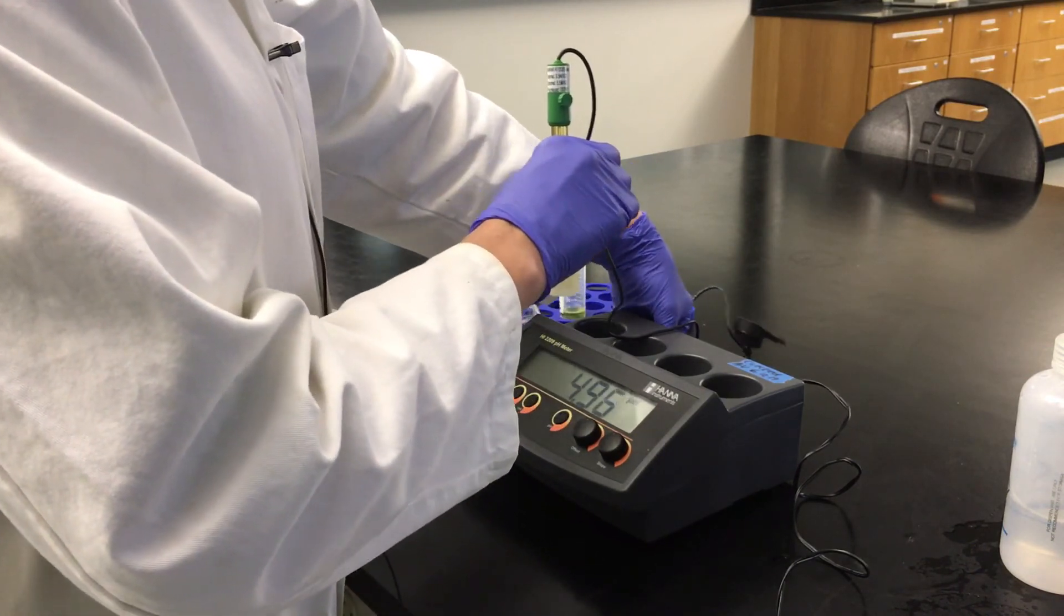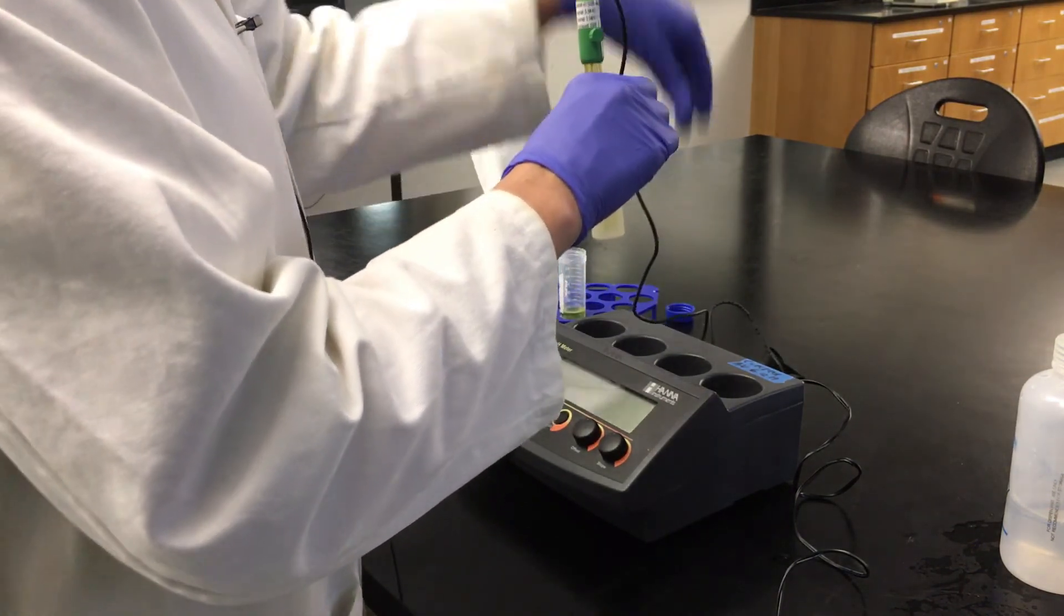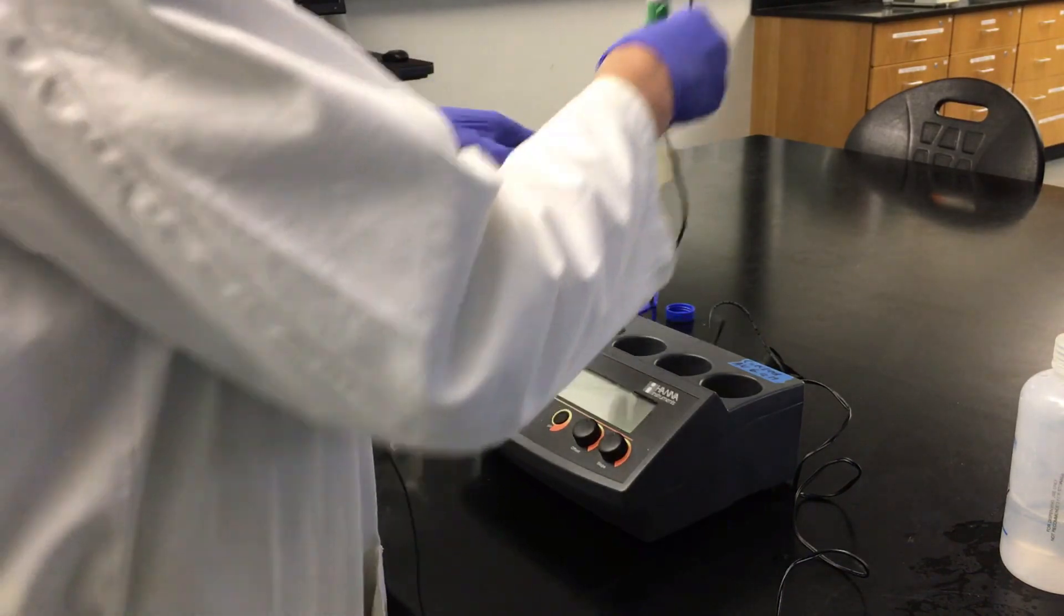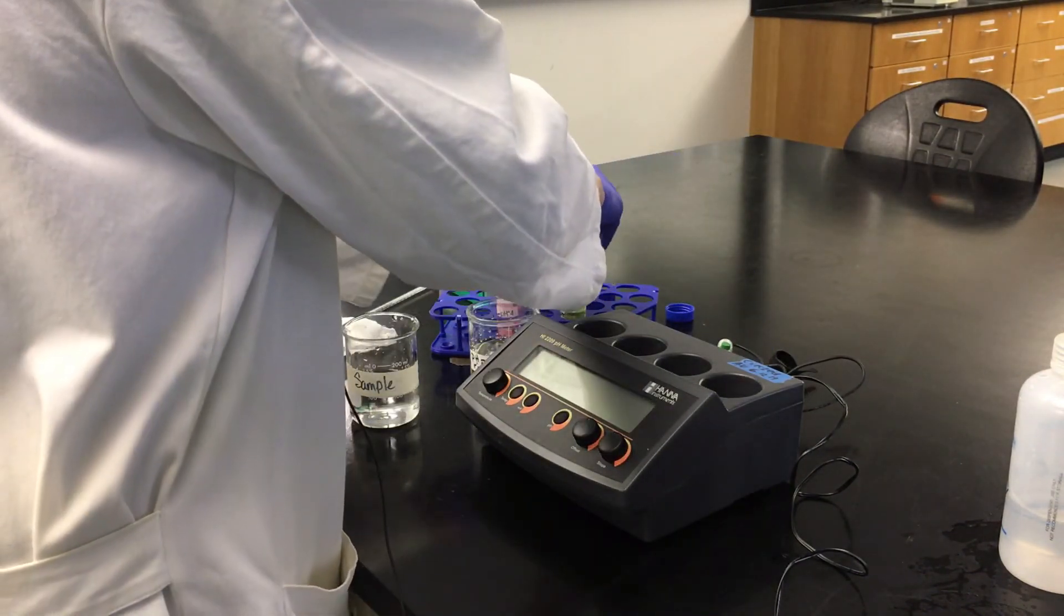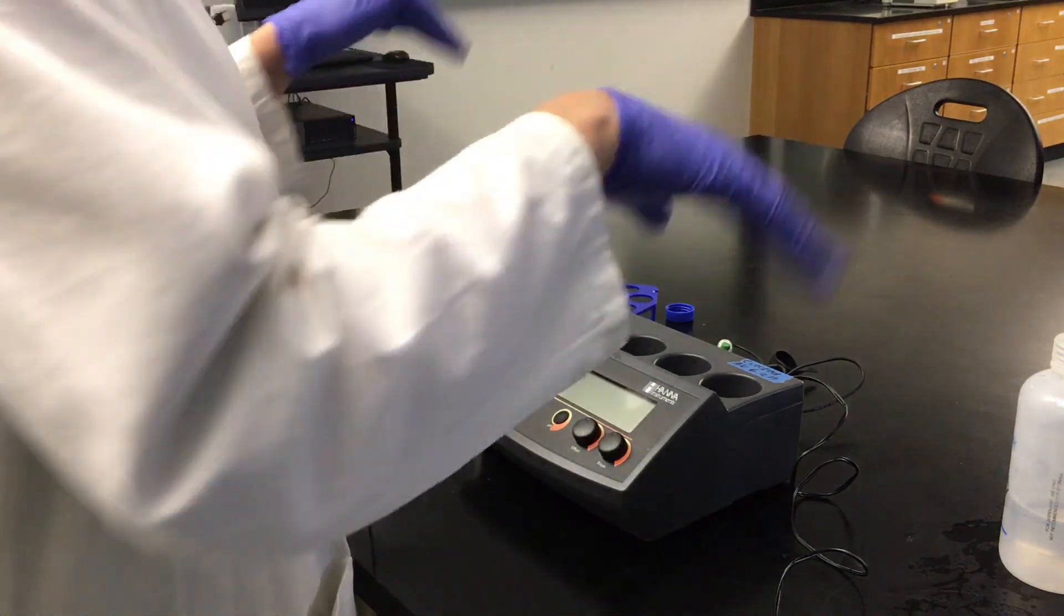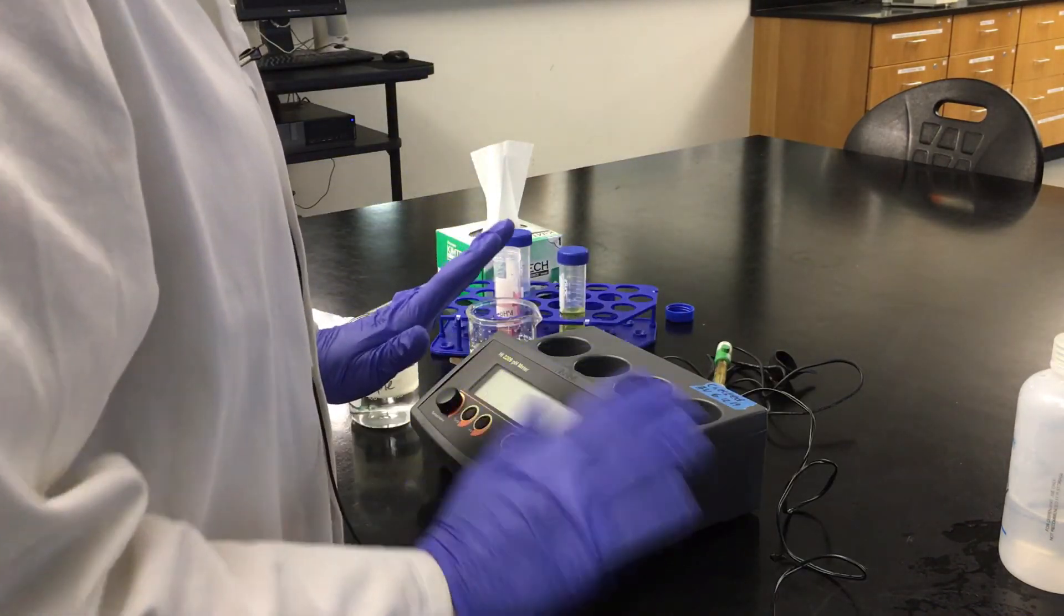We're going to remove the electrode and turn off the meter. You want to make sure you clean up your work area before you leave.